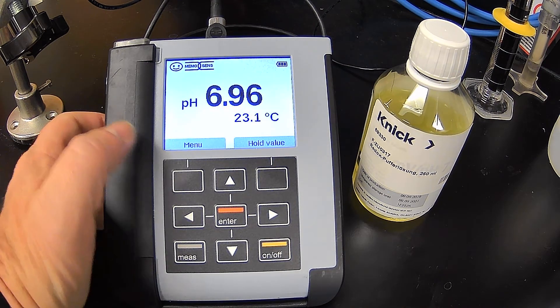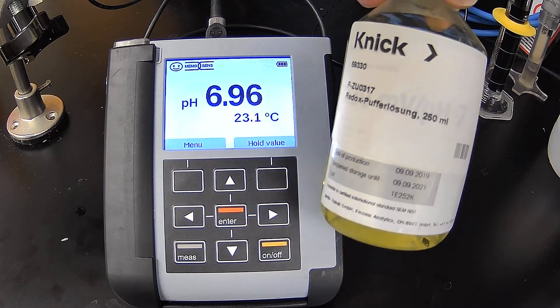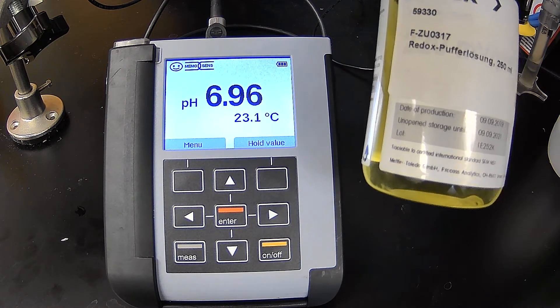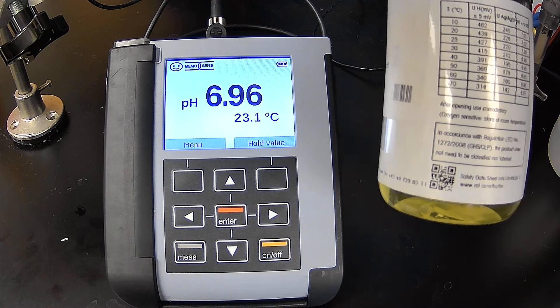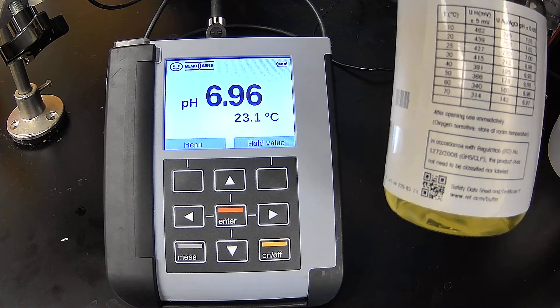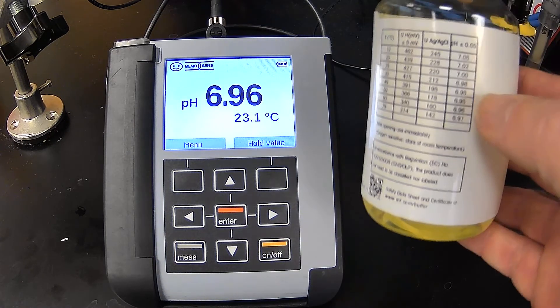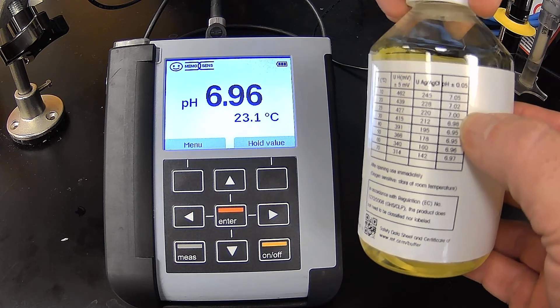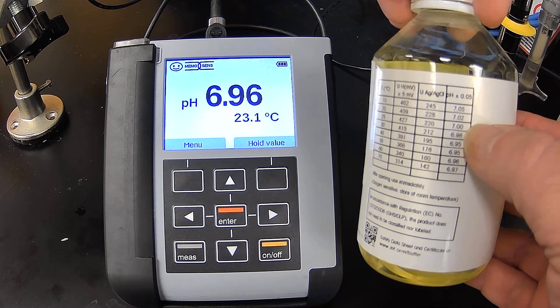Now to do the calibration, and by the way, this is also a buffer seven as well as a 220 millivolt standard. So we can also do the calibration or check it at least because it is a buffer seven.